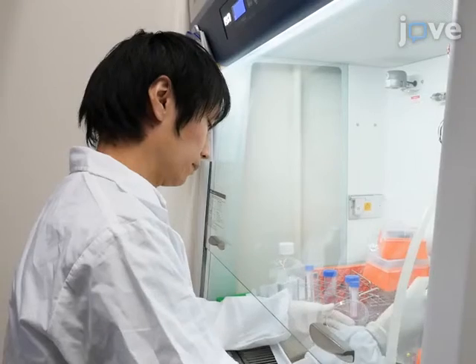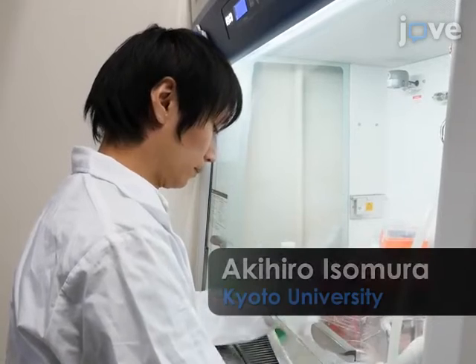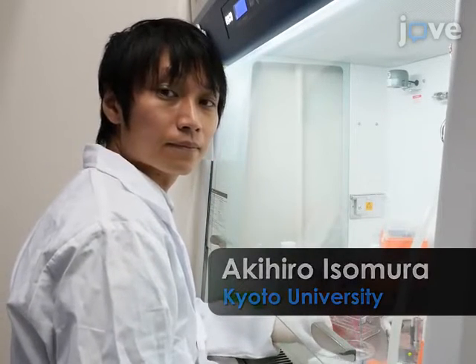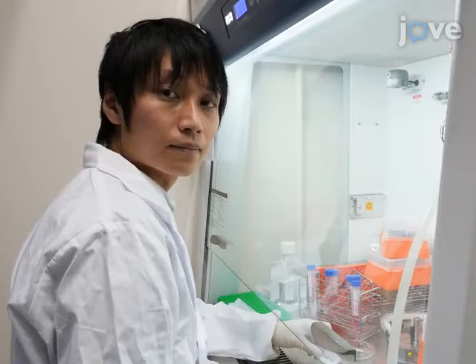The main advantage of this technique is that we can control and monitor gene expression dynamics with very high precision. Demonstrating the procedure will be Akihiro Isomura, a research fellow from my laboratory who developed this new technology.